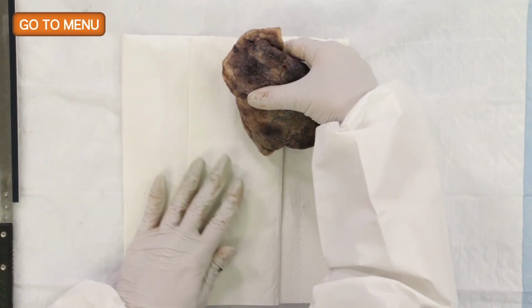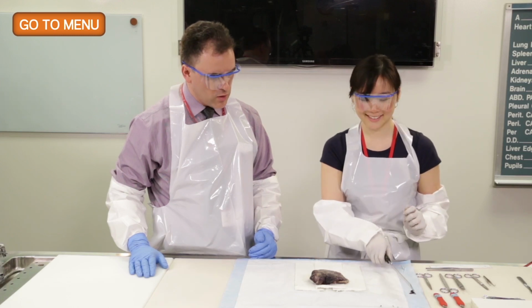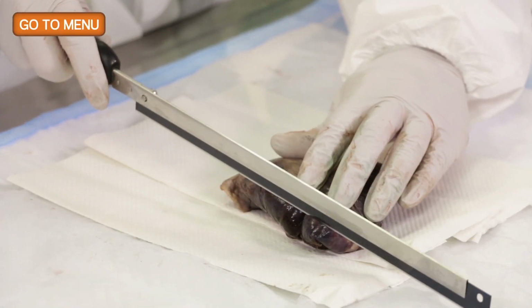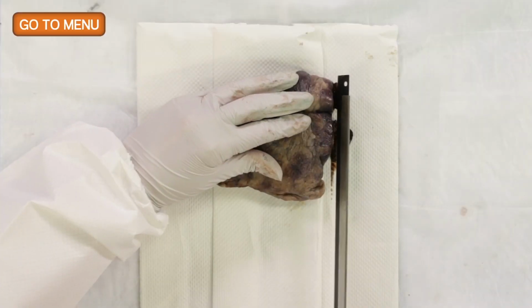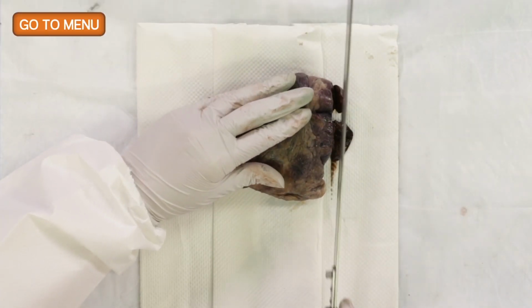A lot of this has to do with having enough traction on the specimen so that it doesn't move during the cutting. As I mentioned, the blade is quite sharp. And so the goal is to get sections through the tumor and also to make the sections relatively thin so that they would be suitable for submission for histology.